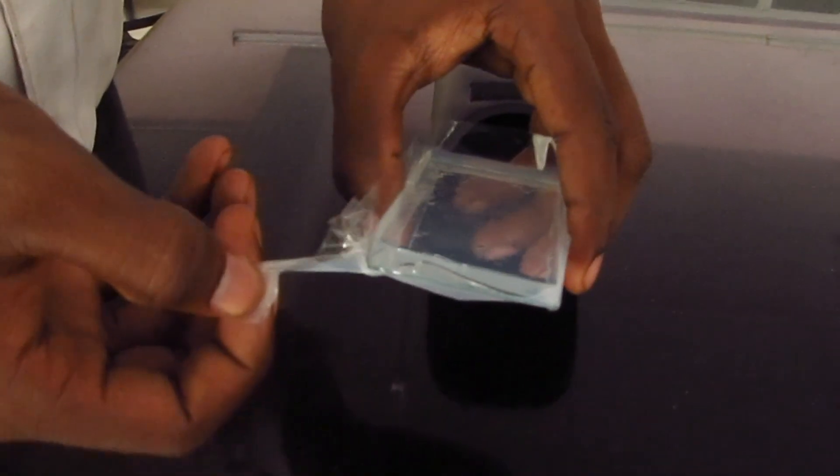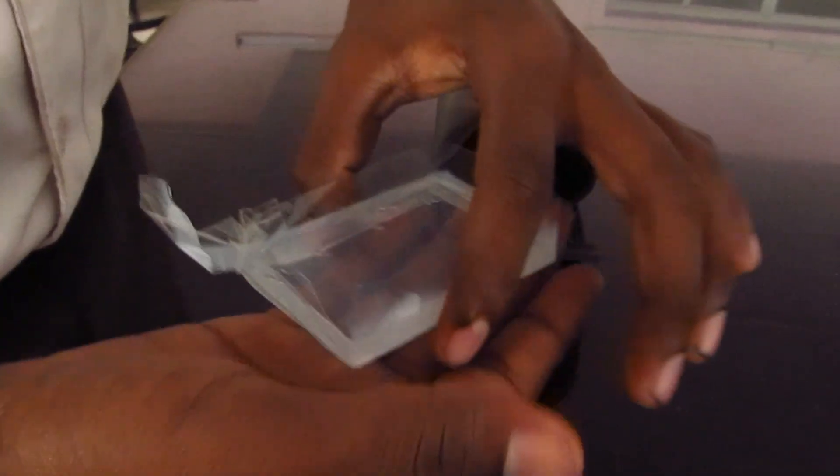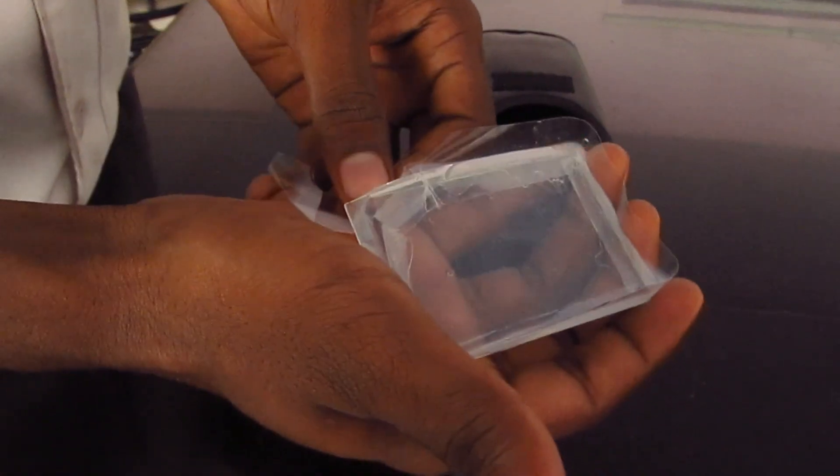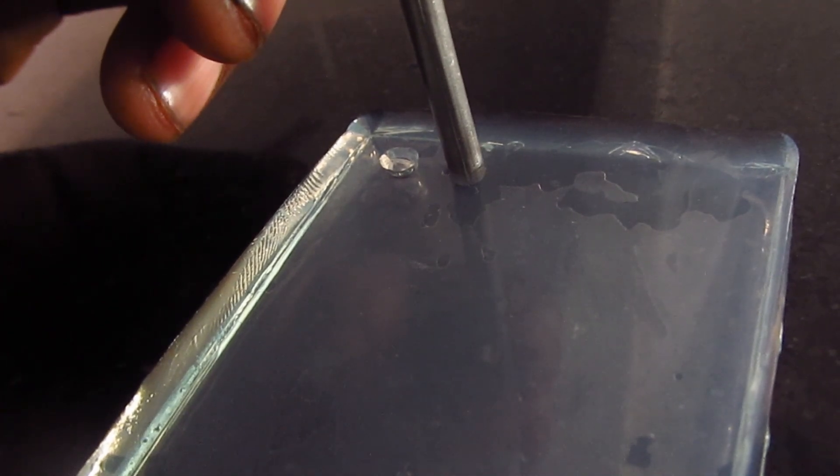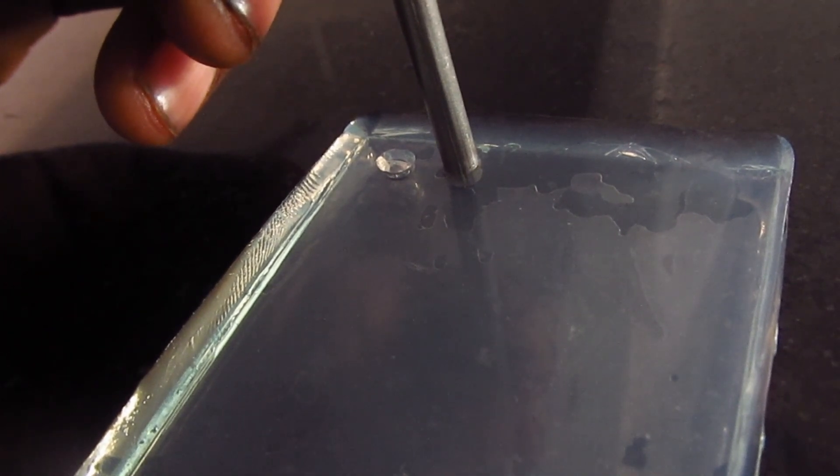Remove the tape carefully after the gel polymerizes. Make holes on the top of the gel using gel borer without damaging the gel.